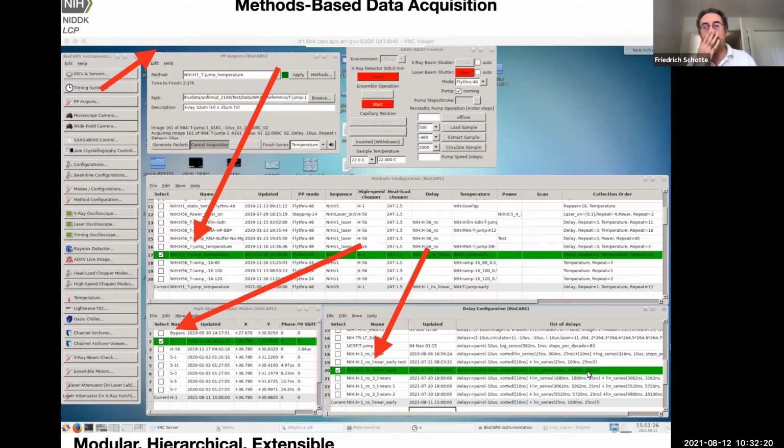So the idea is to have a modular system that is hierarchical and extensible for controlling all the aspects of data collection. Starting with one name in this top level panel, that's for data acquisition, and then fanning out in this hierarchy of linked tables. And the only thing you need to know, except the name of the method, is where to store them. You need to put in a destination directory where to store it, and then you're ready to collect.